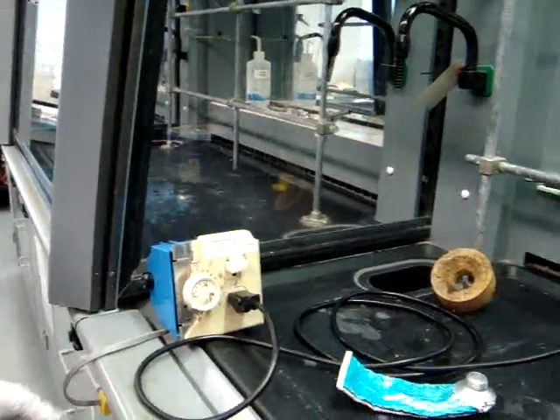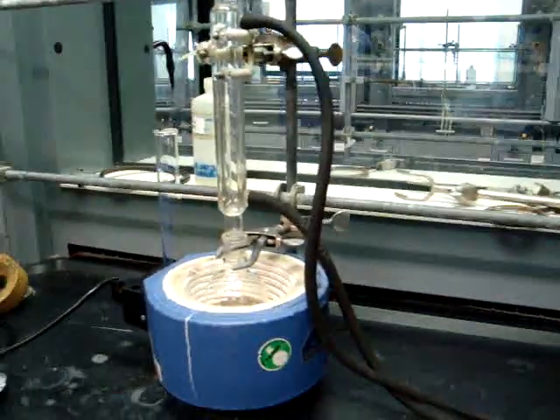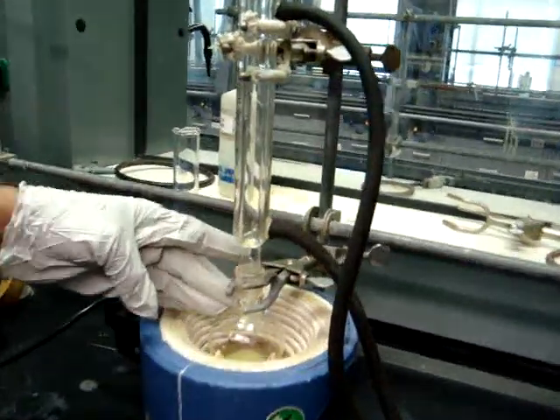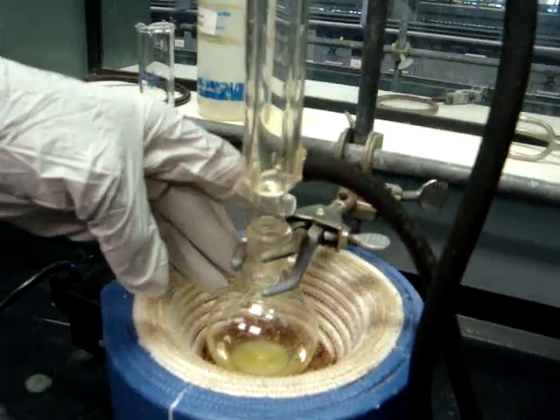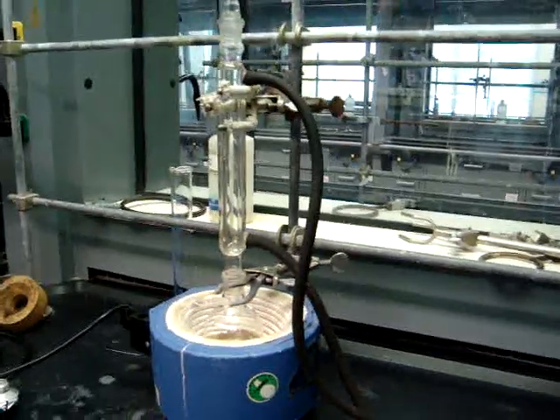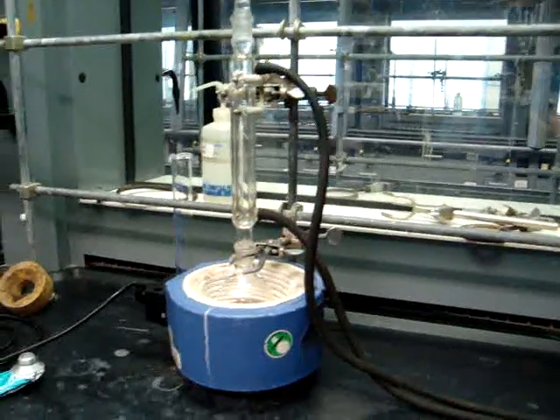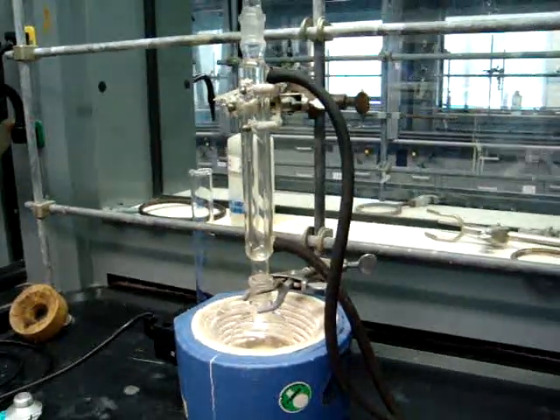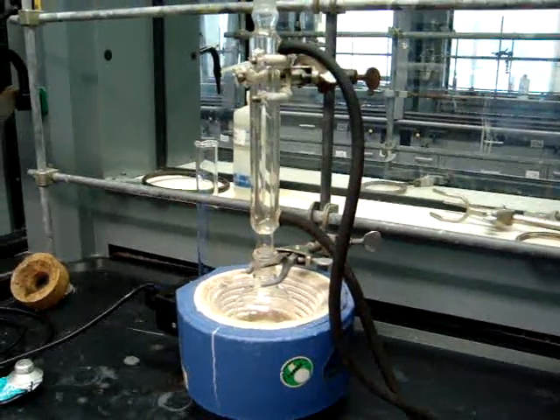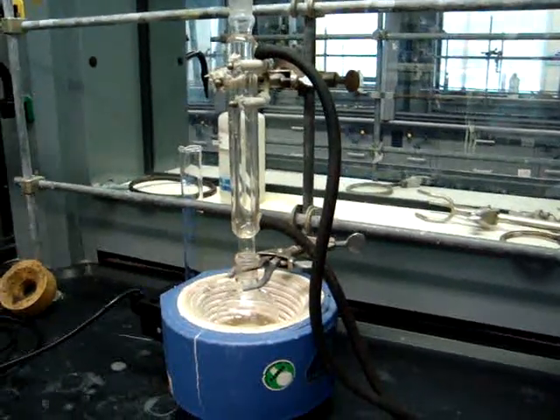Keep your heat at about 3 during the experiment. Once you have added all of your reactants into the round bottom flask along with a minimal amount of boiling chips — avoid adding too many since you will have too many boiling chips compared to your solid at the end — turn on the water and the heat. You will be refluxing for 30 minutes before removing your round bottom flask and placing it in an ice bath for 10 minutes, allowing the solid to crystallize.